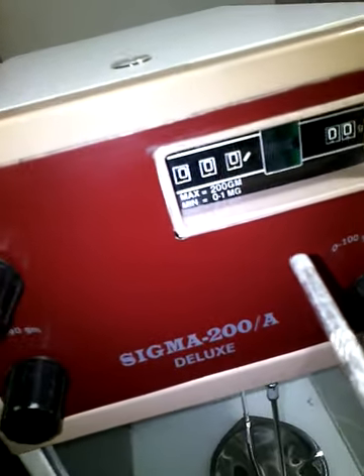If you proceed toward the left side of the balance, you will find a triangular shaped operating knob, which is mainly used for operating the balance.